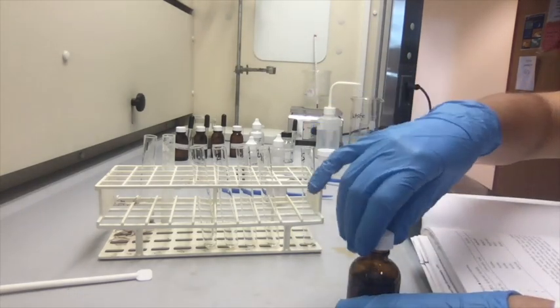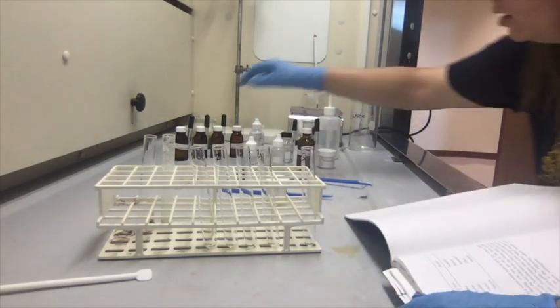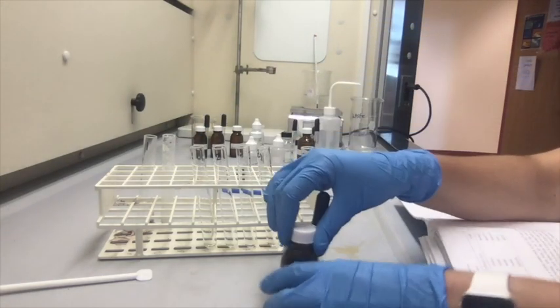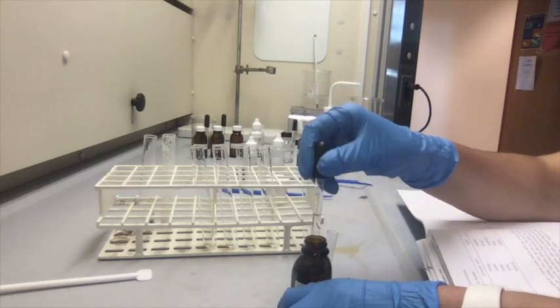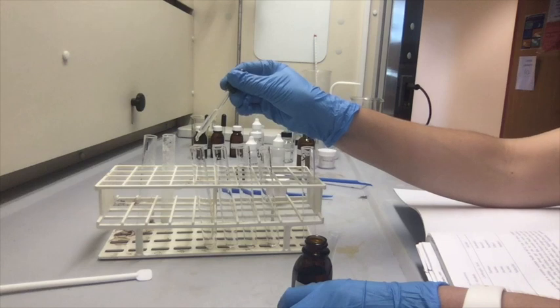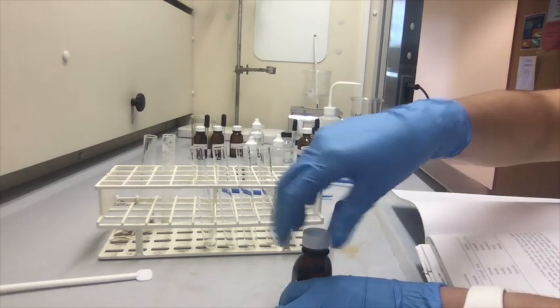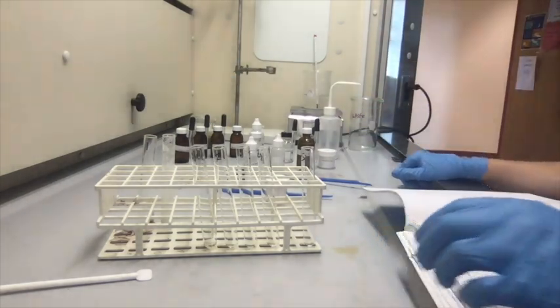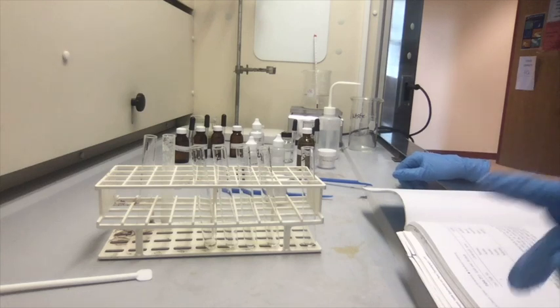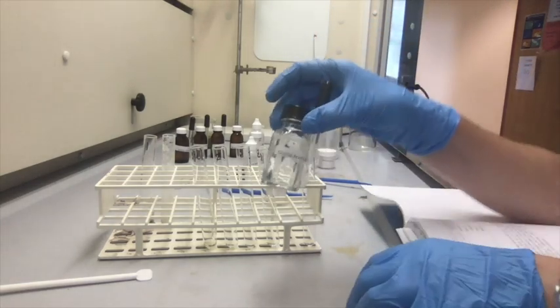And then test tube 2, 3, and 4. Or you know what? Let's add the isobutanol right away, so 10 drops of isobutyl alcohol. 1, 2, 3. There we go. And then we're going to add 10 drops of acetic acid into test tubes 2, 3, and 4. So we're going to use the glacial acetic acid as we used before.